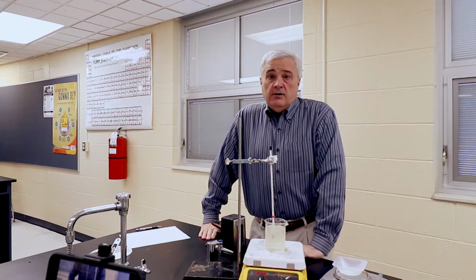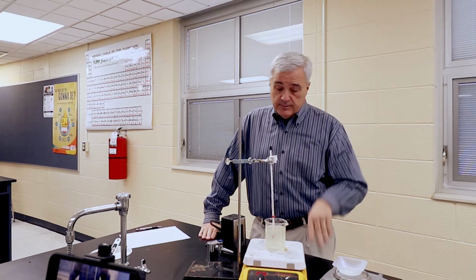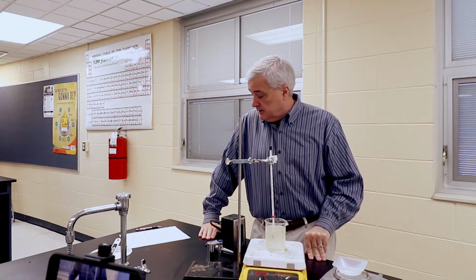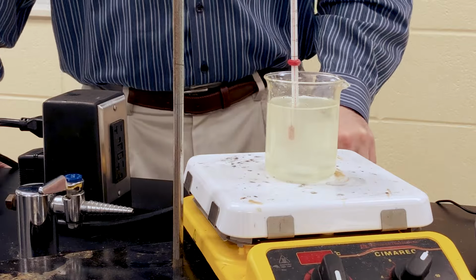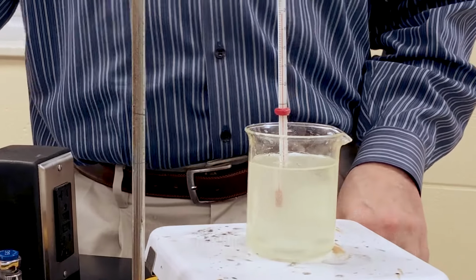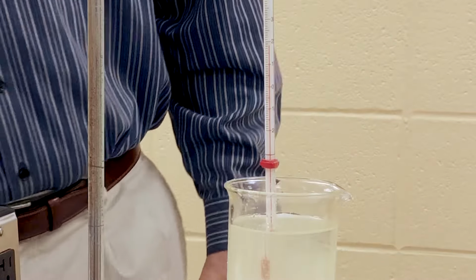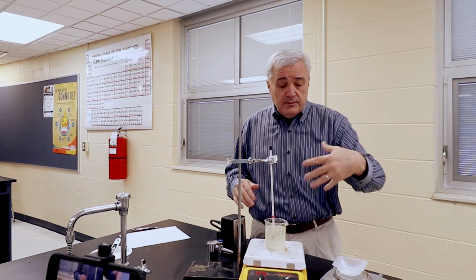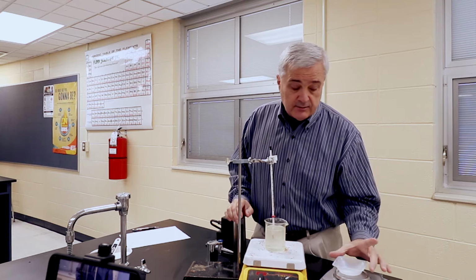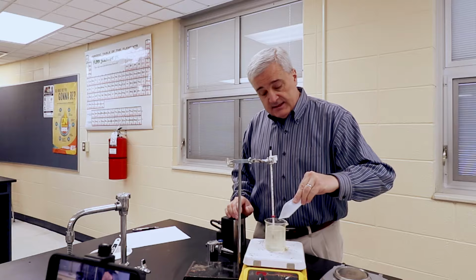All right, a lot of sugar has passed since I cut the video and came back on here. We're up to over 190 grams of sugar. The volume of the solution has increased significantly. The temperature is currently, I'm calling it 19 degrees. And the last few times I've been measuring out in smaller gram increments. This is 1.14 grams. I'm going to add this in.